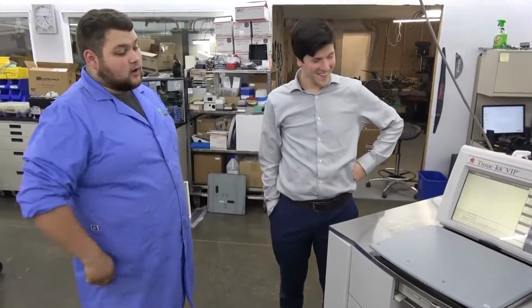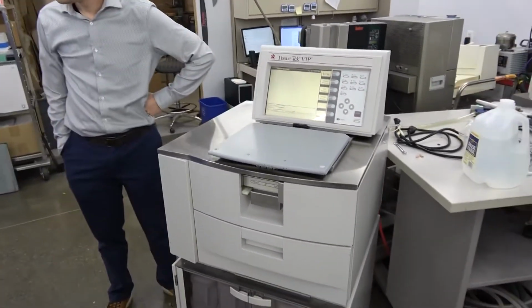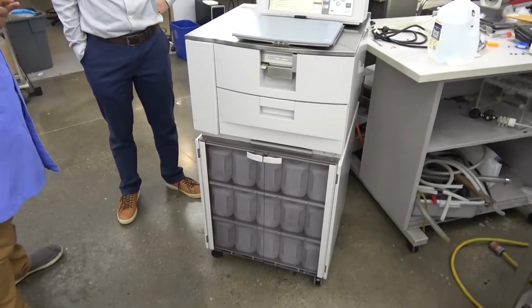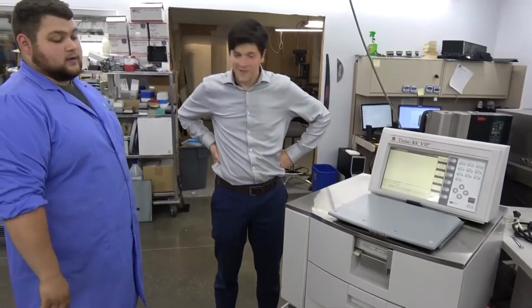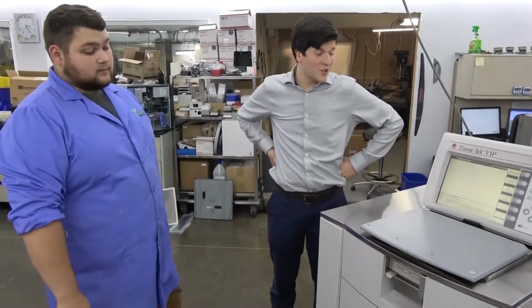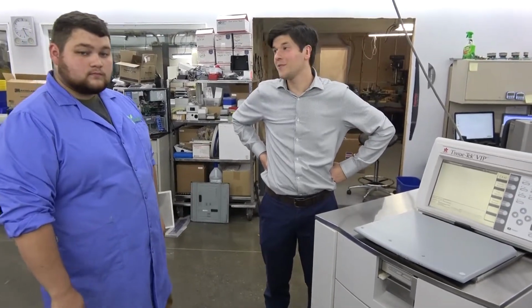It had a real strong odor to it, and it wasn't accepting the bottles, so you can't run programs or anything like that. So we took a lot of time, pretty much stripped it all the way down, toothbrush, and put it all back together. And I got her working and functioning pretty well. Sometimes cleaning is the magic with a tissue processor. Yep. Well, we're going to get to that.